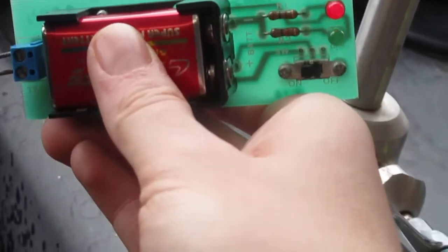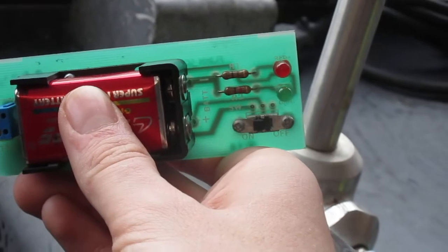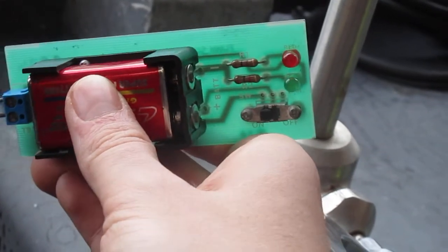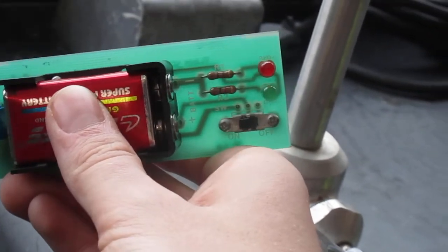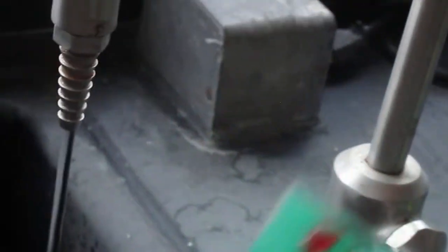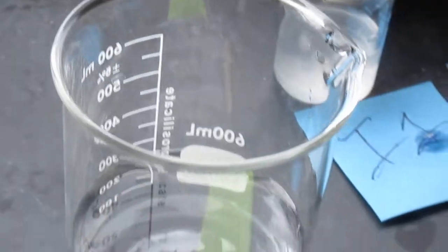It's going to be tough but you can kind of see that blinking. There we go. This tap water does conduct but this pure water doesn't. That's because there are ions.